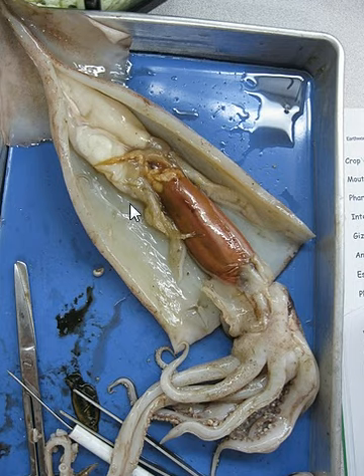And that is about it for squid. To recap: the hearts are right here, the stomach, the liver, the brain, the eyes, the arms — eight arms and two tentacles. The reproductive organ is called the gonad. The mantle is around here, the pen is behind the liver and organs, and these are the fins on the dorsal side. And that's about it.